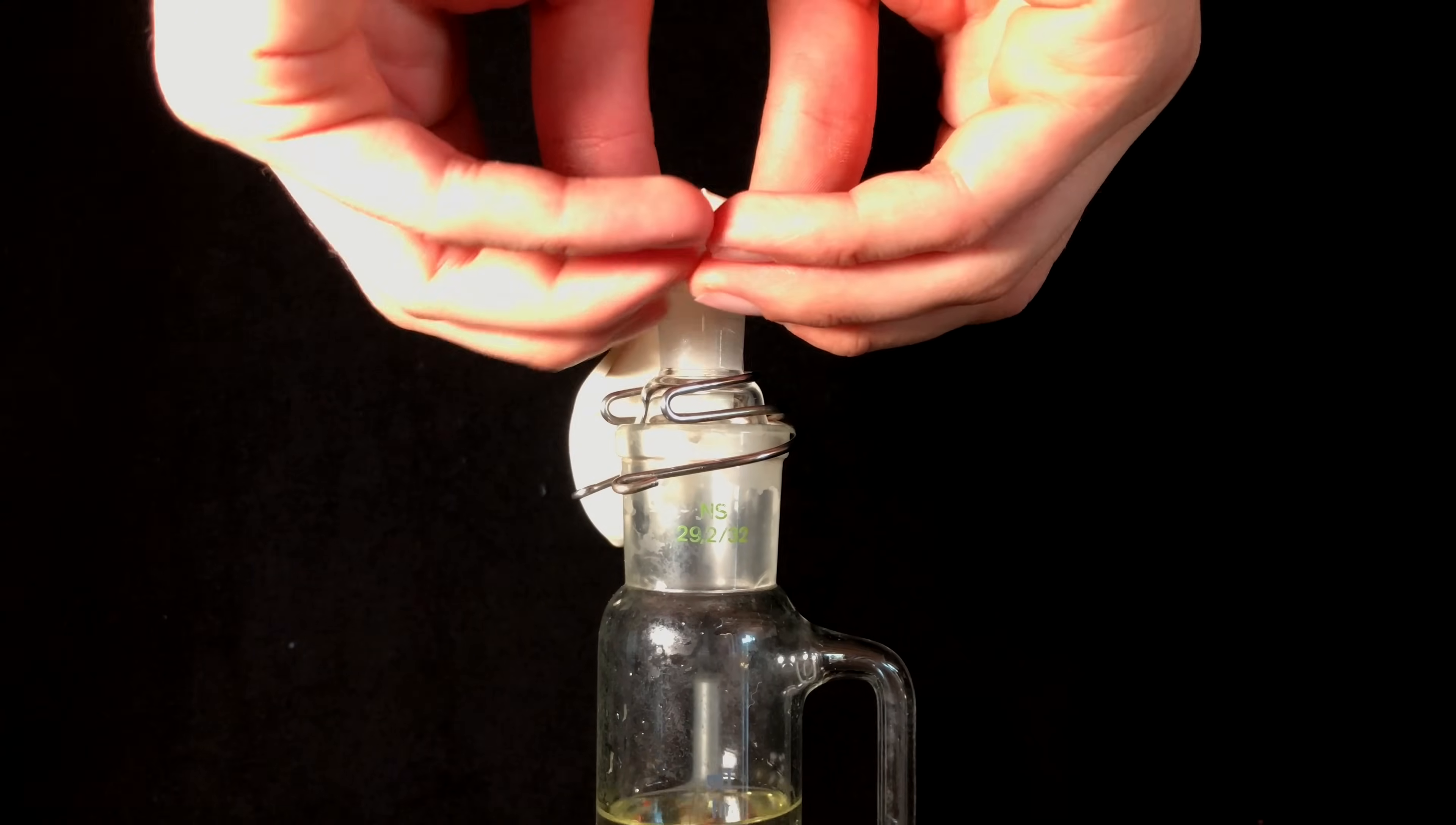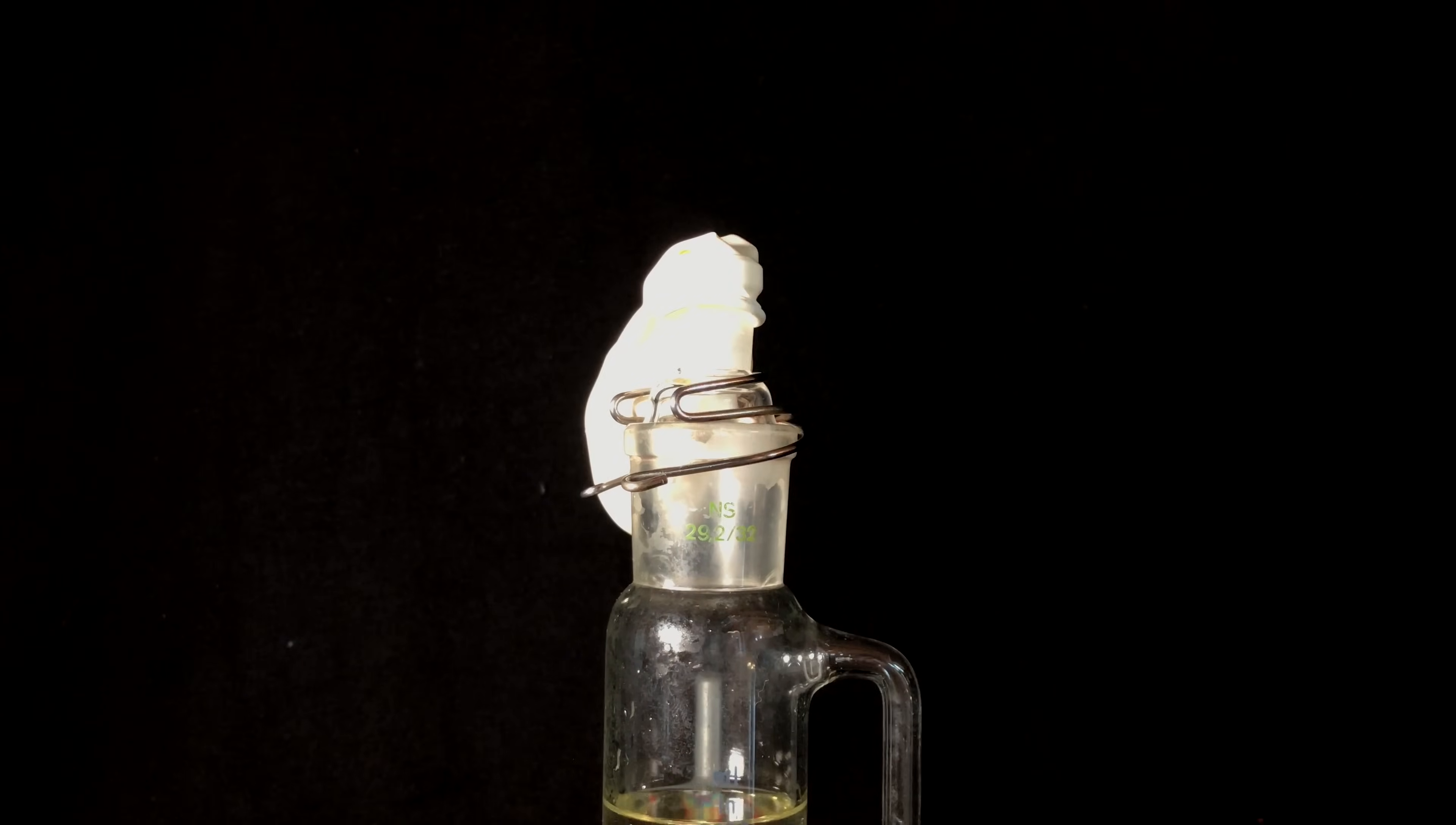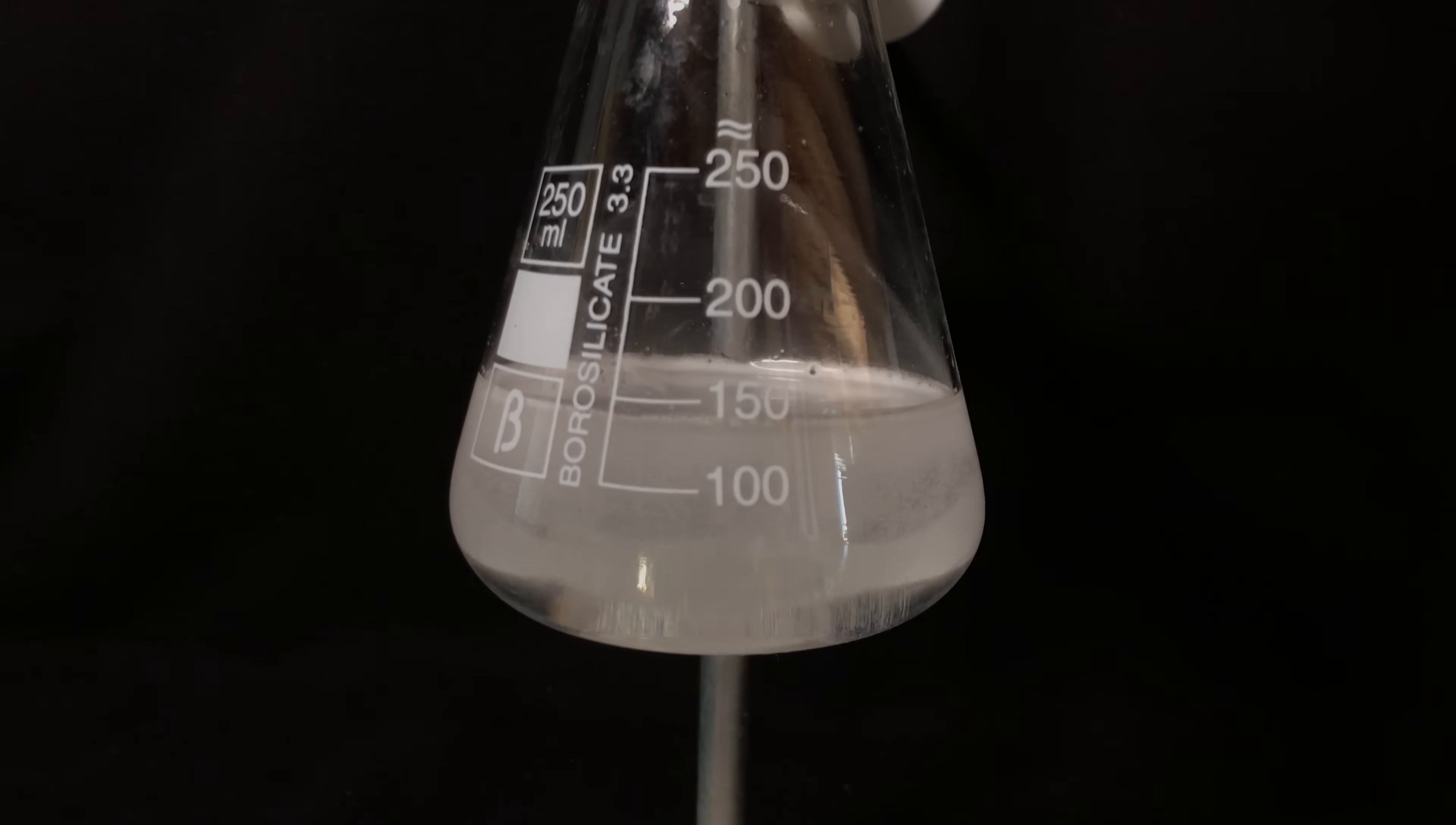To capture the resulting gas, I added this air balloon. You could of course purify the laughing gas by passing it through a washing bottle with a suitable liquid and later on through a drying tube, but I only wanted to demonstrate this process and for that I don't need pure laughing gas.